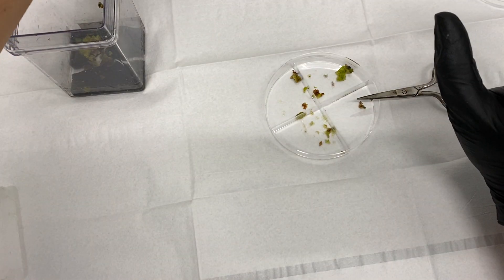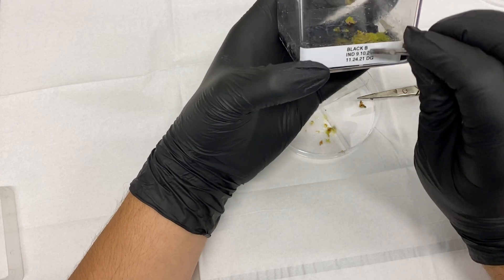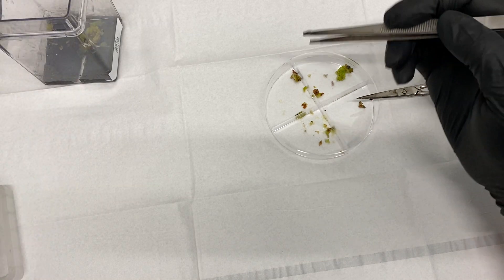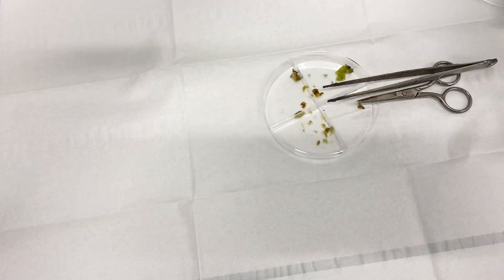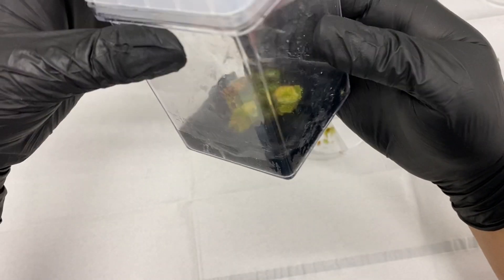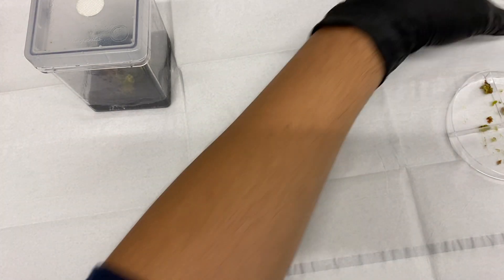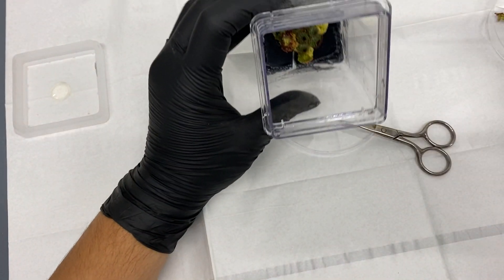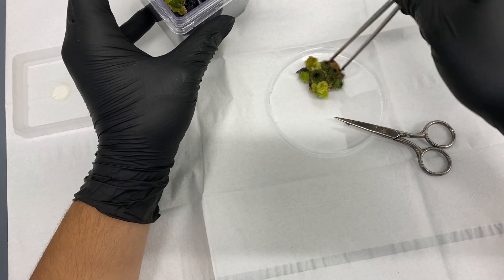It's one of my favorite cacti I've done tissue culture with. I couldn't remember the name so I labeled it 'black barrel,' but now I know it's a Frailea. It was started in September, so we've got a lot of growth and a lot of plants since then. This is actually another box from the same embryogenic callus — it's all from the same source. Wow, a monster.